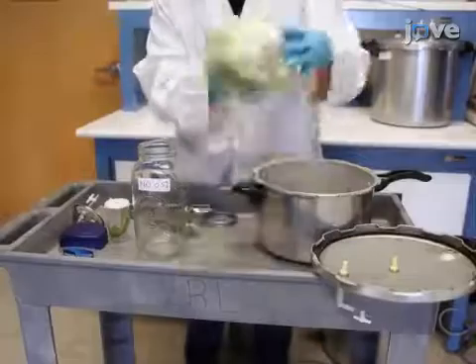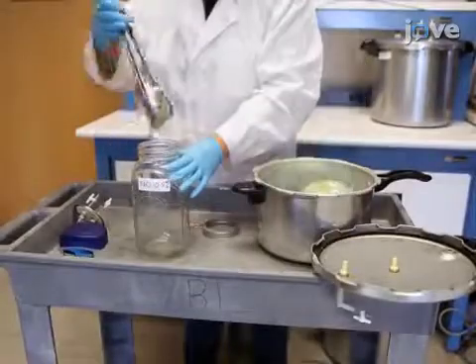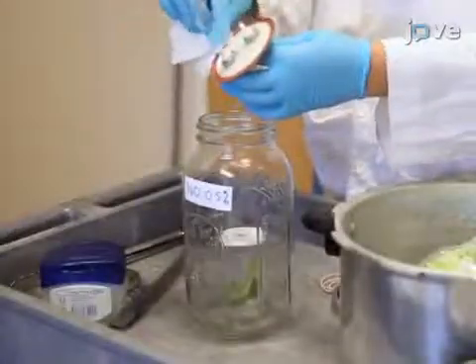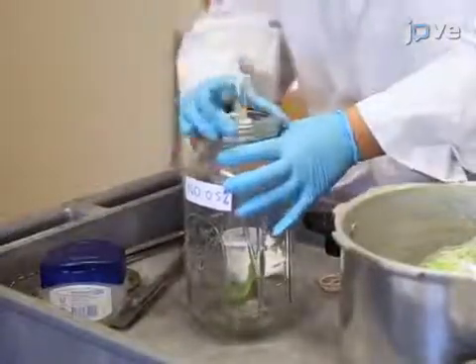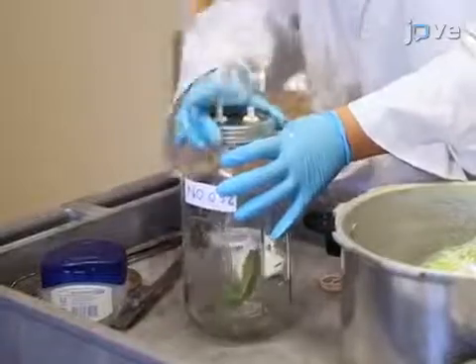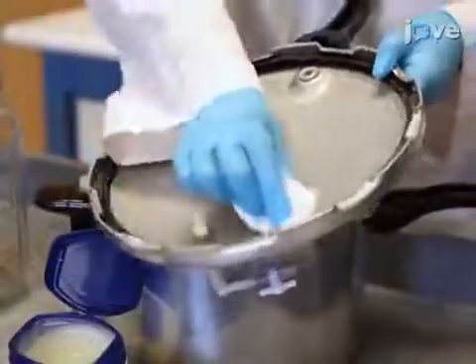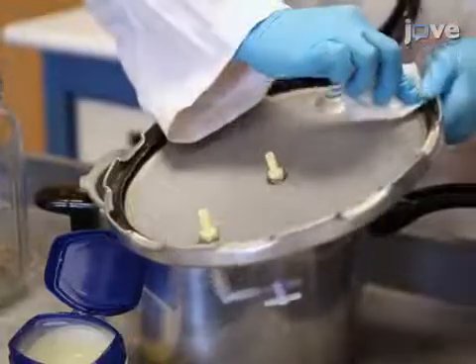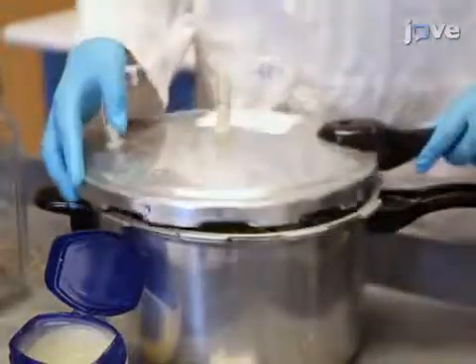To begin, load the chambers with insects or products. Grease the gaskets with petroleum jelly and seal the chambers airtight. It is important during nitric oxide fumigation to keep the chambers sealed airtight, so be sure to properly grease the chamber gaskets and keep the lids on tight.